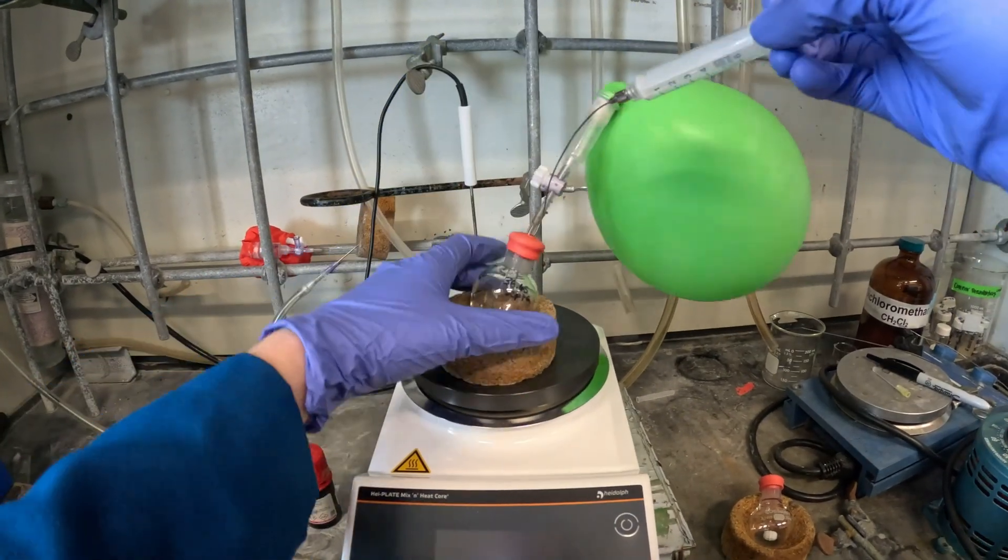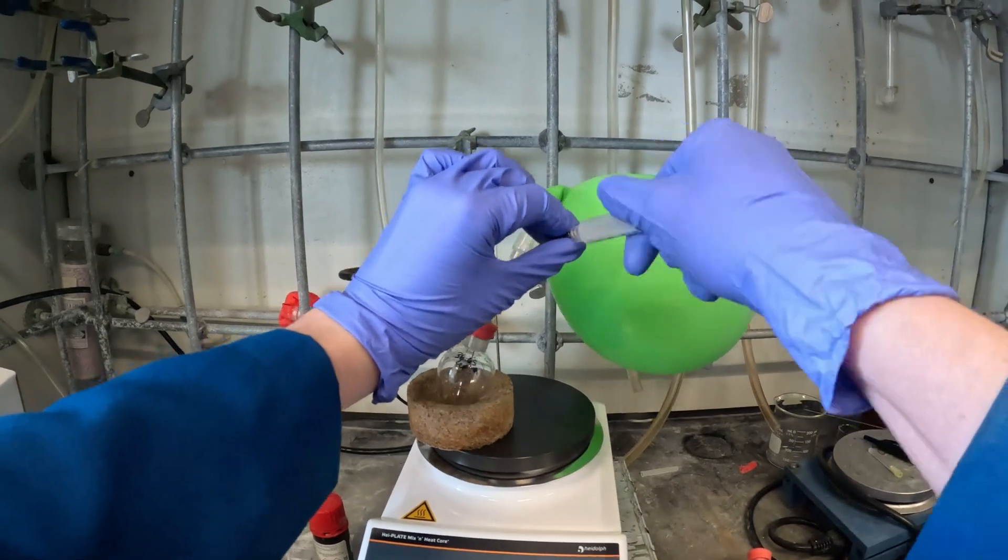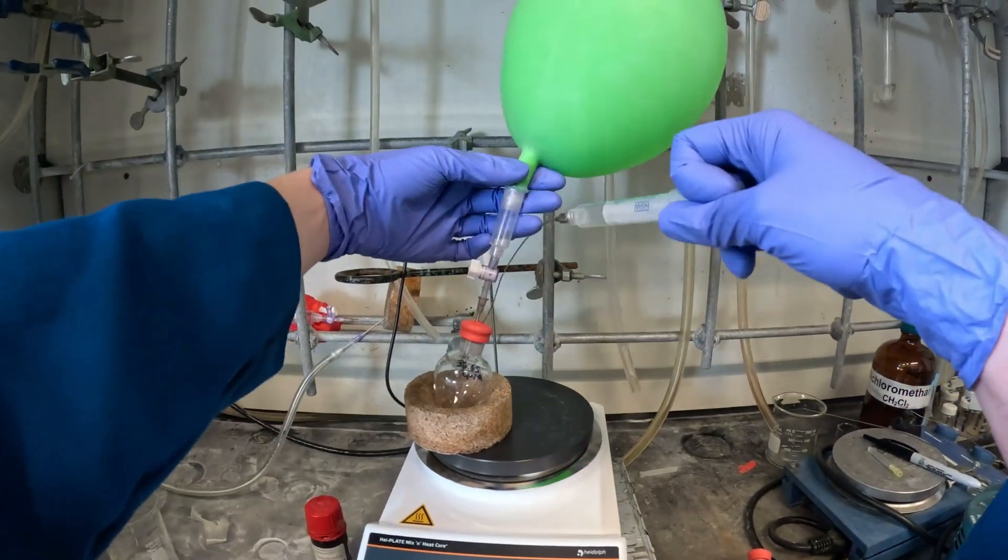What you're seeing me do here is purging the needle and syringe with argon that I'll be using to collect the BBR3 from the reagent bottle.